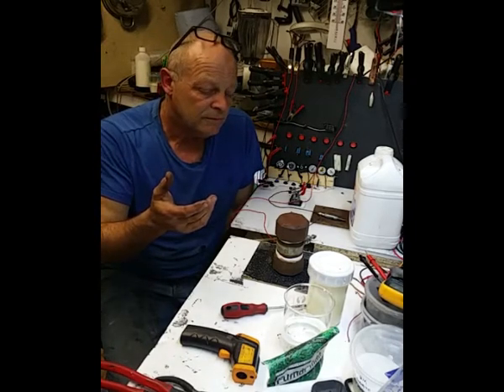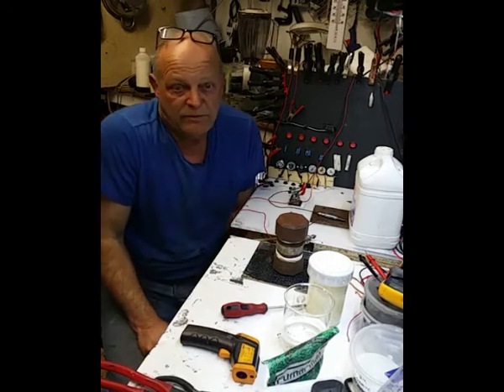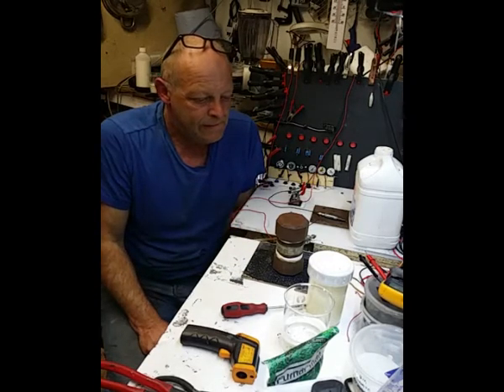So I'm just going to leave that now for an hour or so, see what happens, and I'll come back.